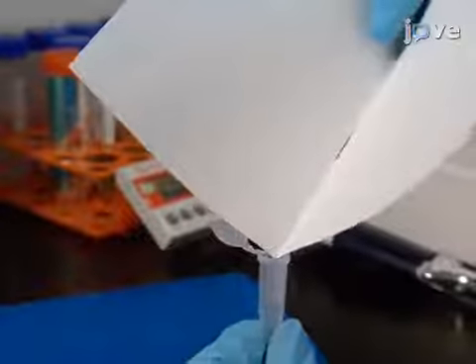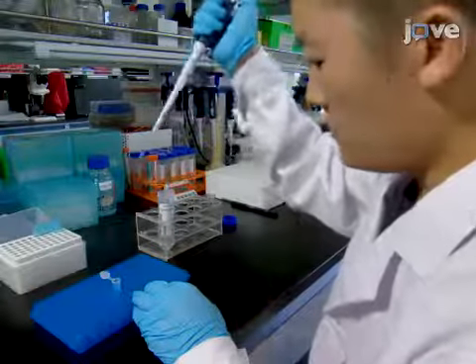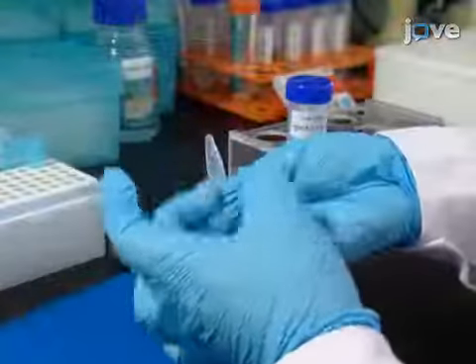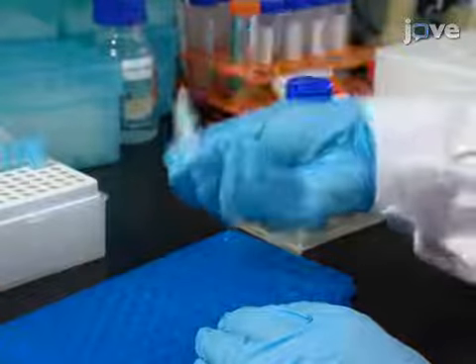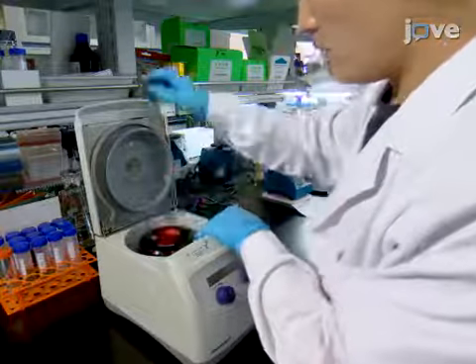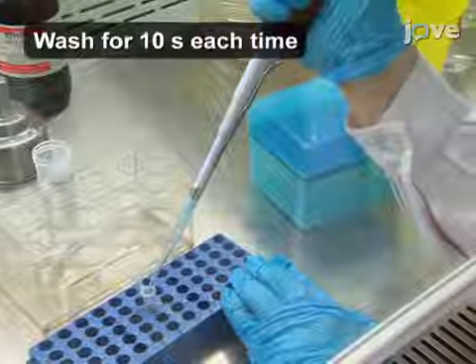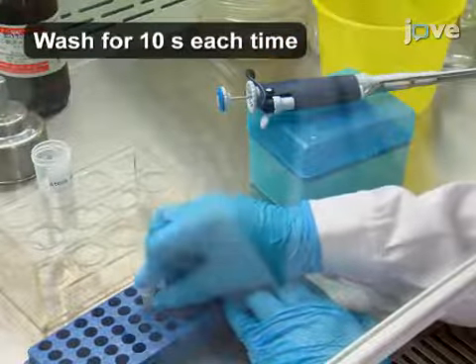To begin this procedure, add 100 seeds to a 1.5 milliliter tube. Add 1 milliliter of sodium hypochlorite to sterilize the seeds. Invert the tube several times to ensure that the seeds and solution are well mixed. After 5 minutes, centrifuge the tube at 1200 g for 30 seconds. Remove the supernatant and wash the seeds with sterile water 4 times to remove any residual sodium hypochlorite.